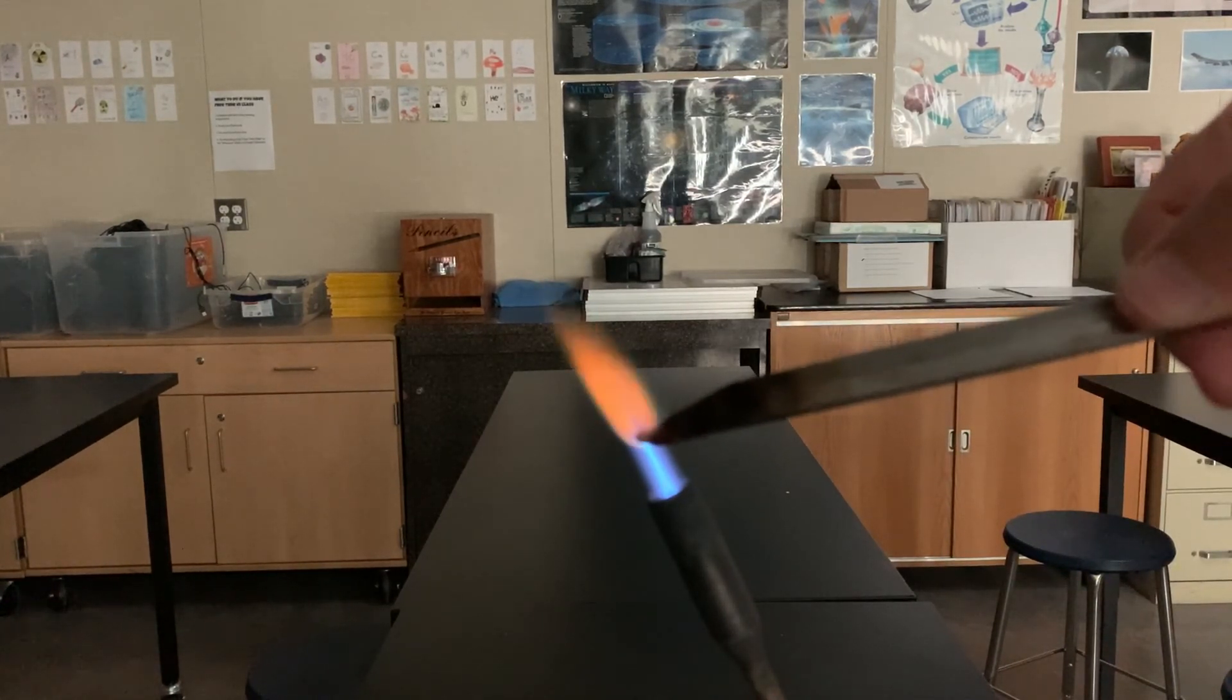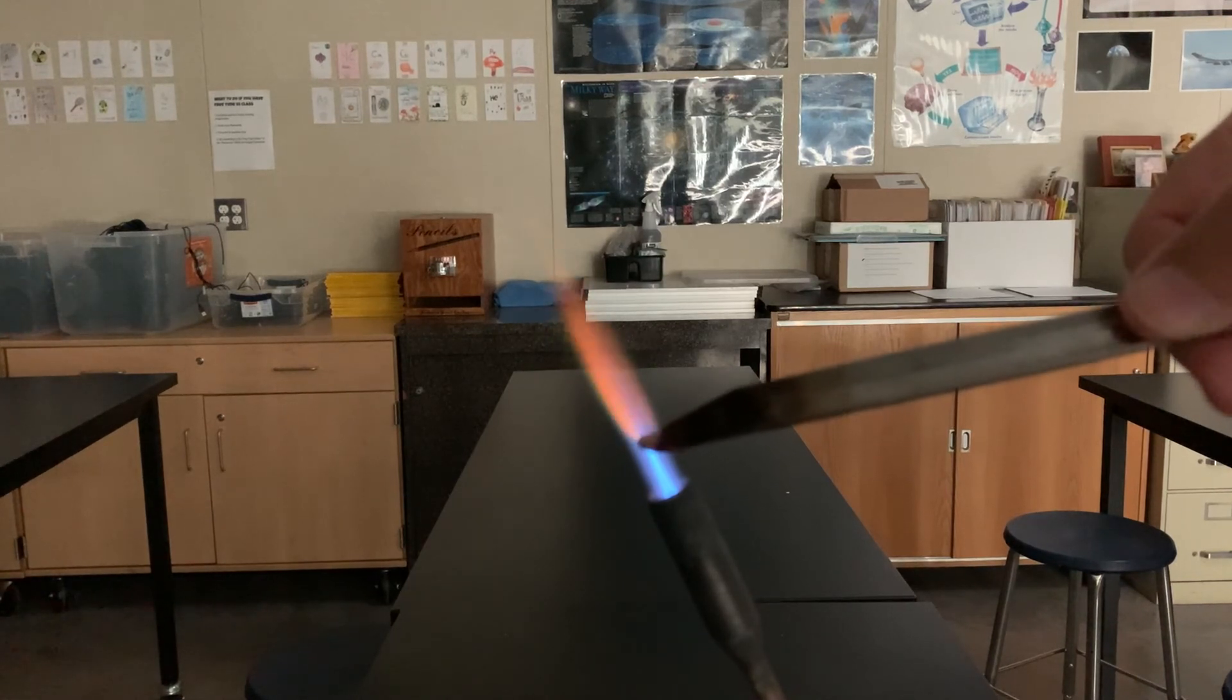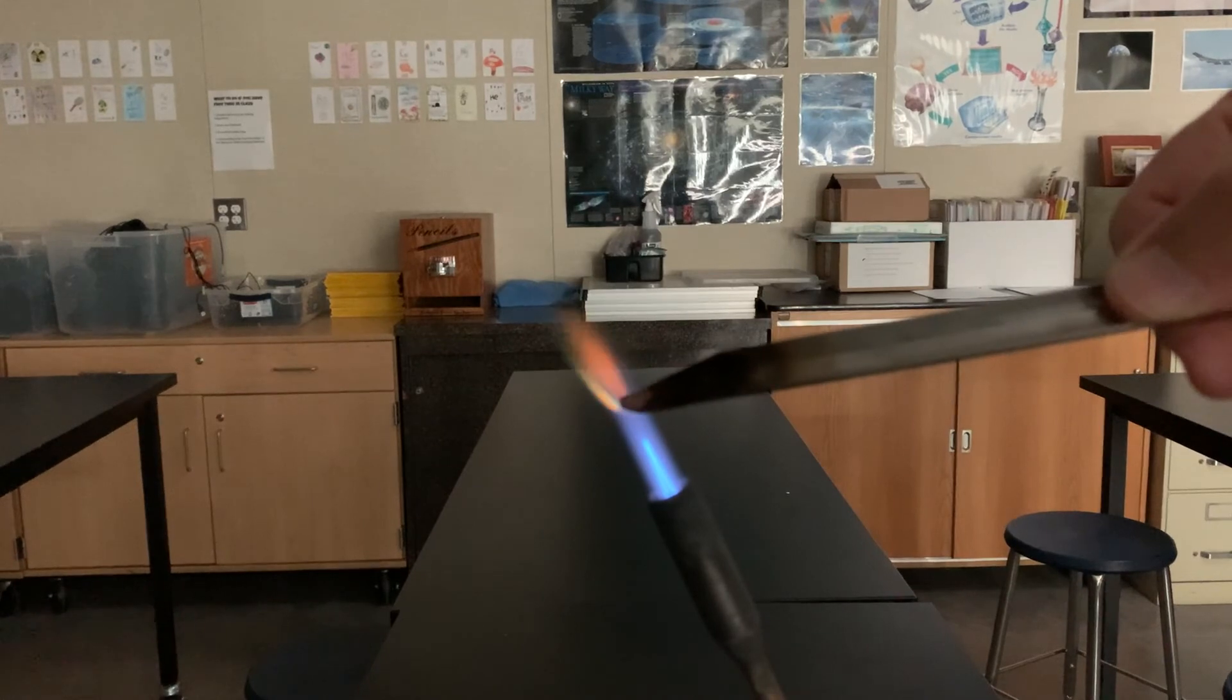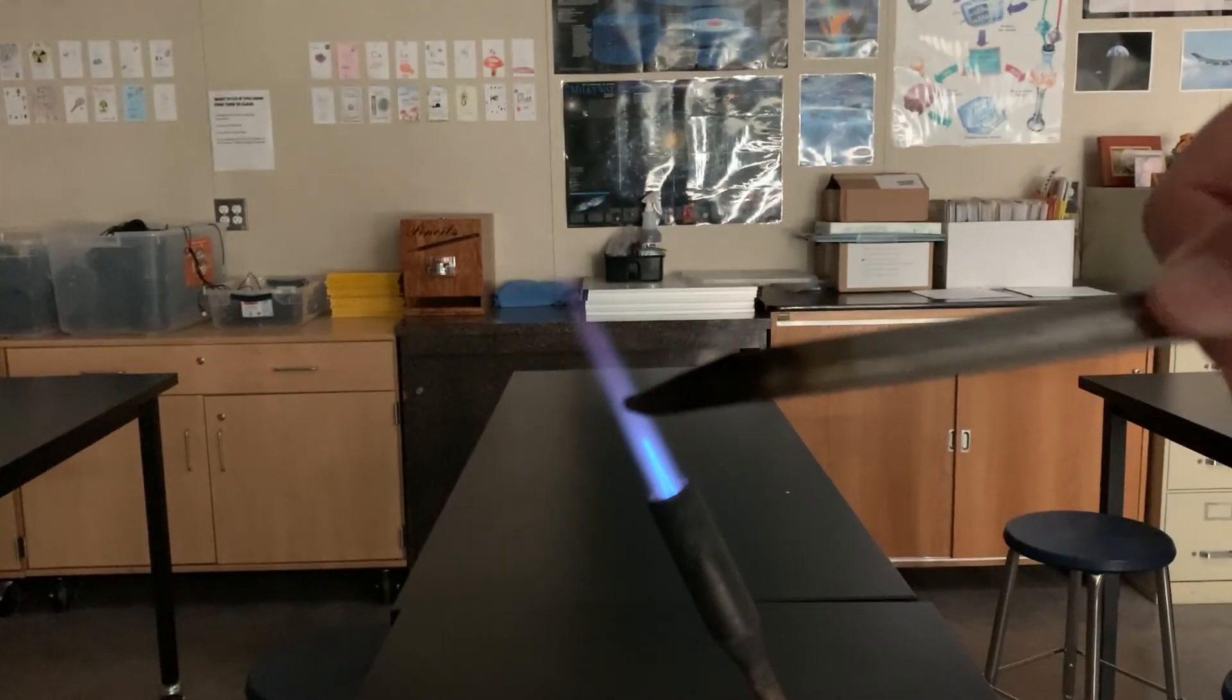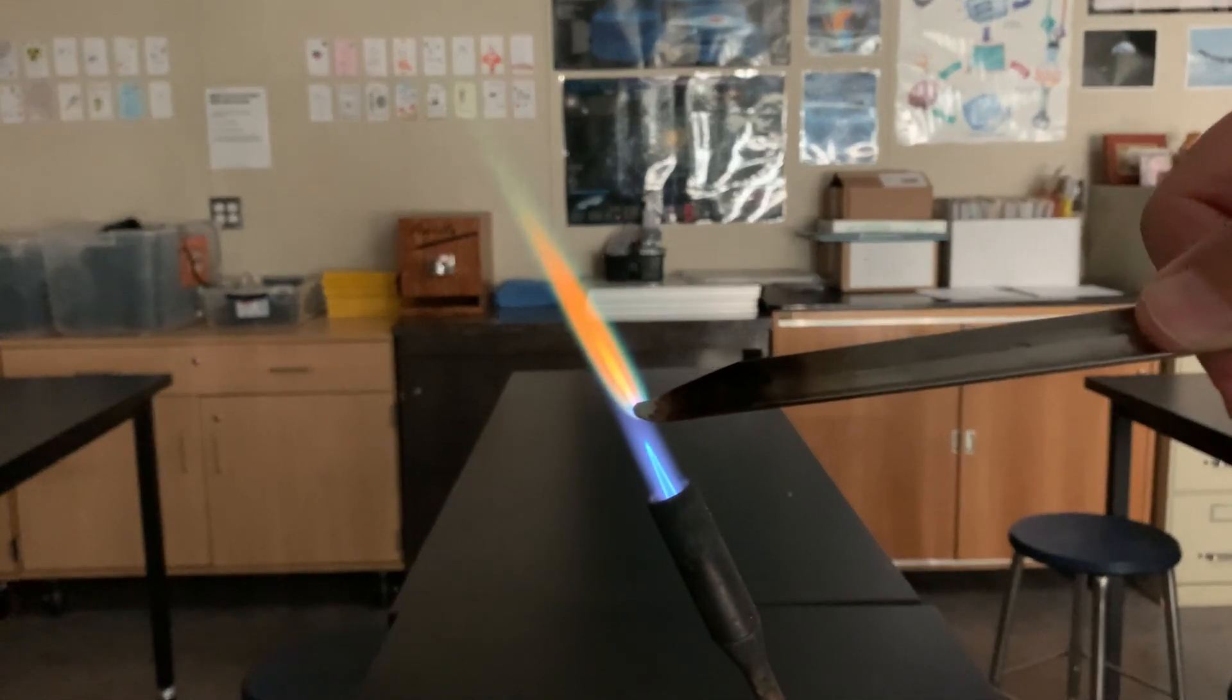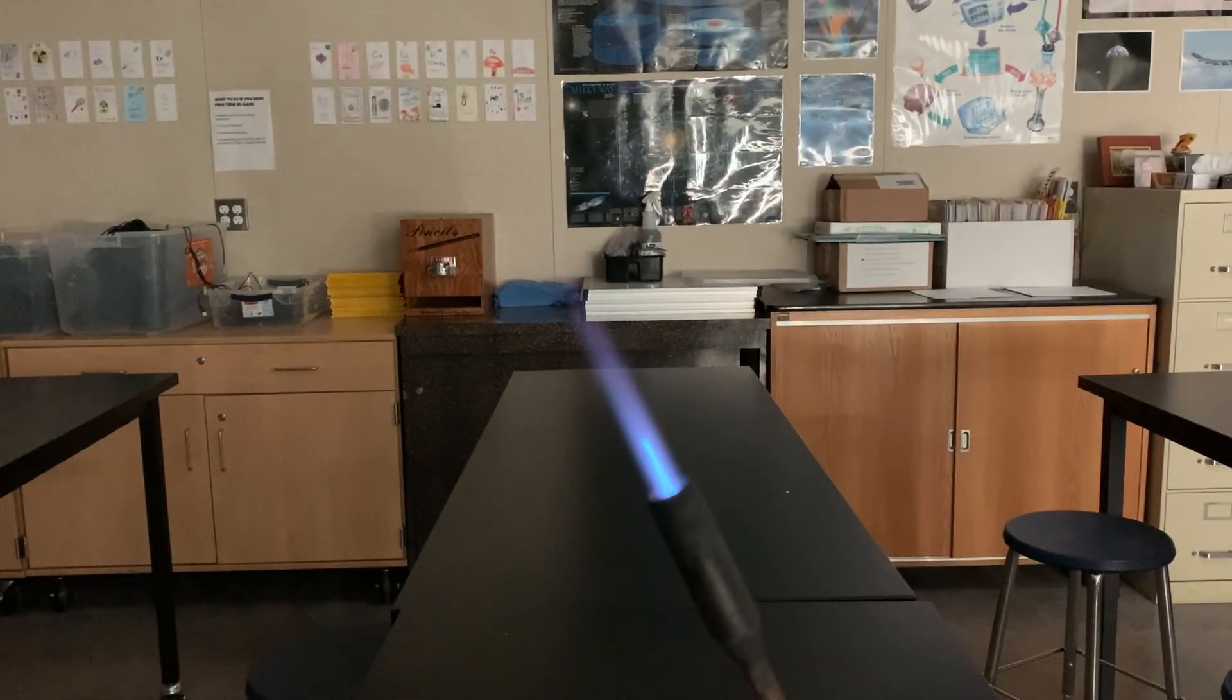This one produces a type of orange. The chemical is really beautiful, but the flame it produces is kind of ordinary to me. That was the orange you saw.